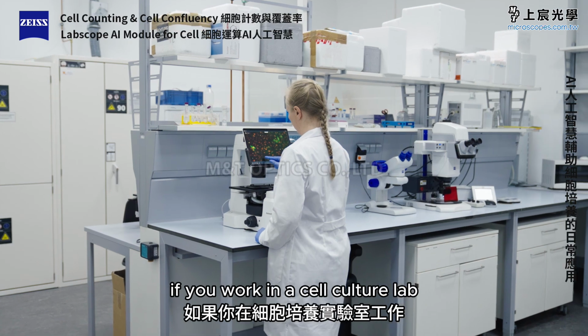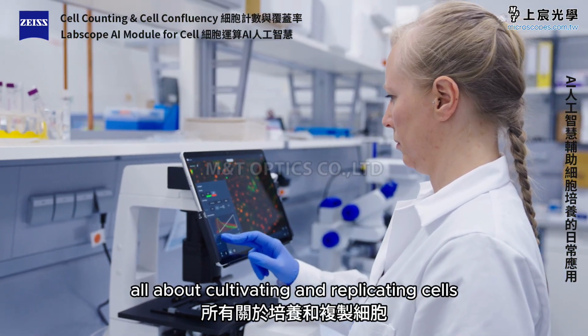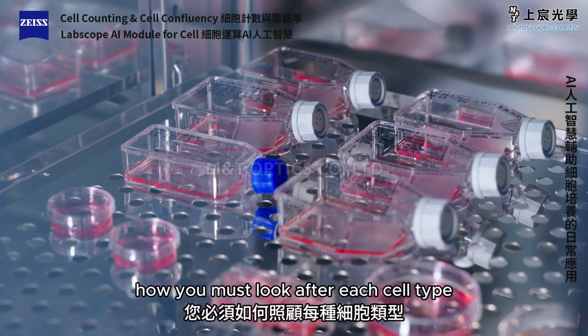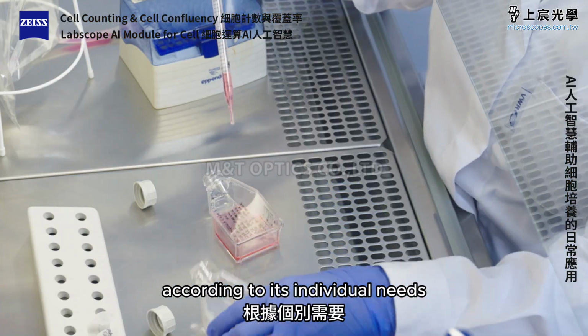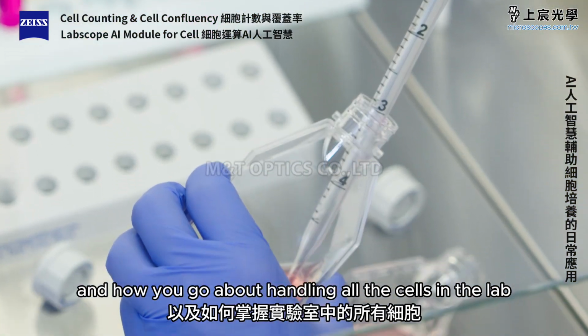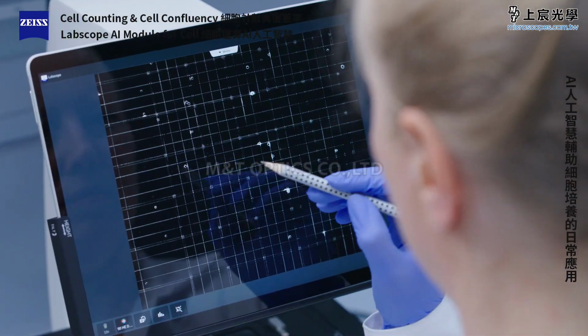If you work in a cell culture lab, then you'll probably know all about cultivating and replicating cells, how you must look after each cell type according to its individual needs, and how you go about handling all the cells in the lab, measuring their confluency and counting them.